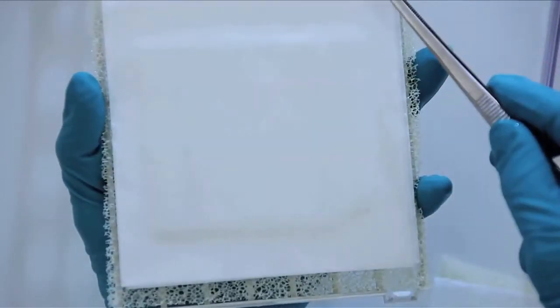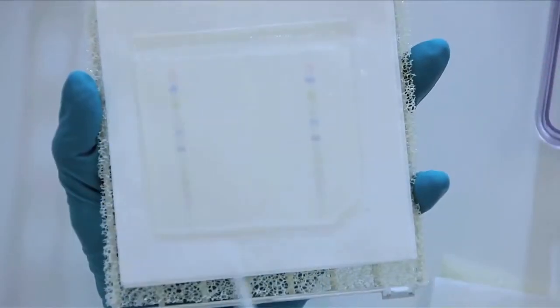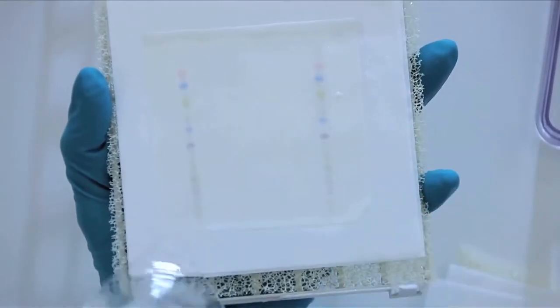Confirm the transfer by looking at transferred rainbow markers on the membrane. If it looks like this, you are doing well.